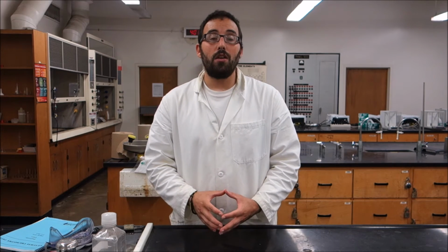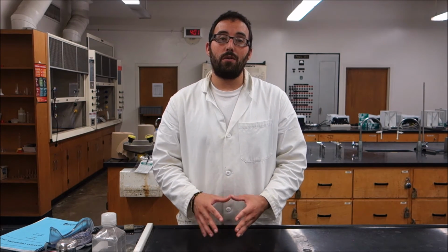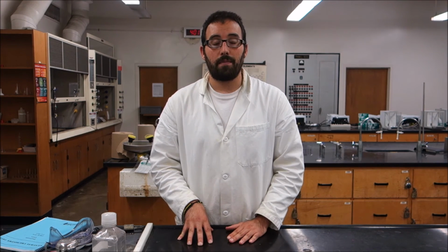After that, you're going to measure your hydrogen wavelengths. You are then going to take the distances that you measure and plug them into the equation that you found for your helium. So your helium acts as your standard curve, and your hydrogen is going to be a set of values that you plug into there.